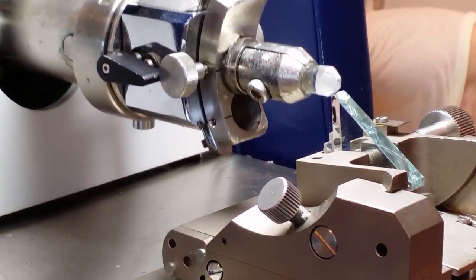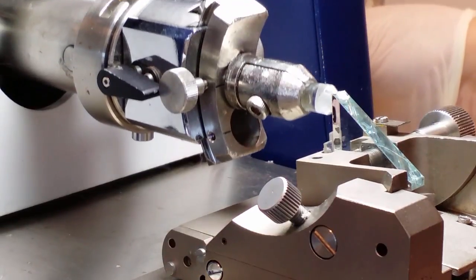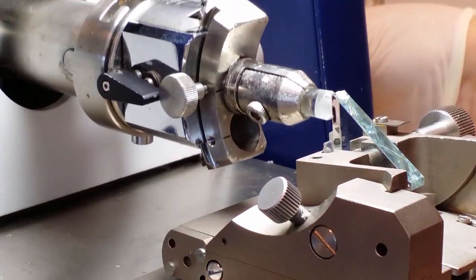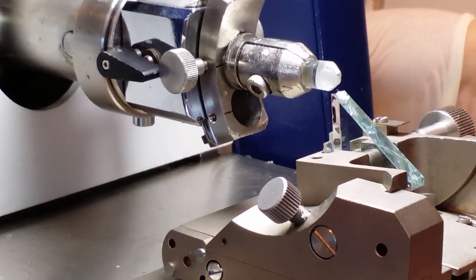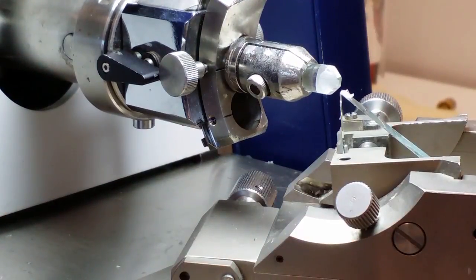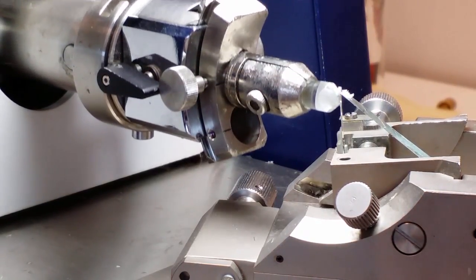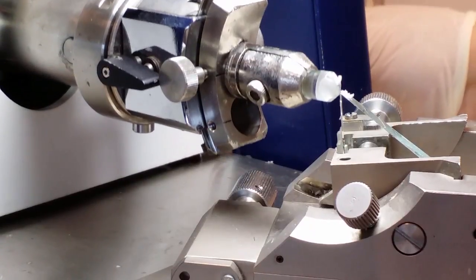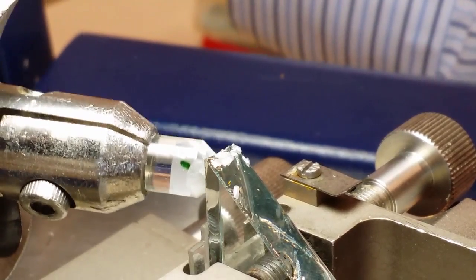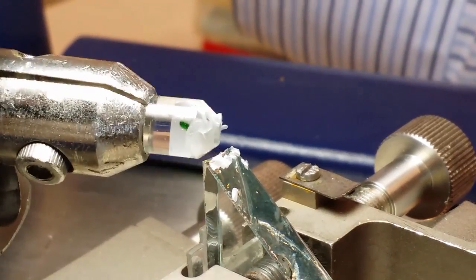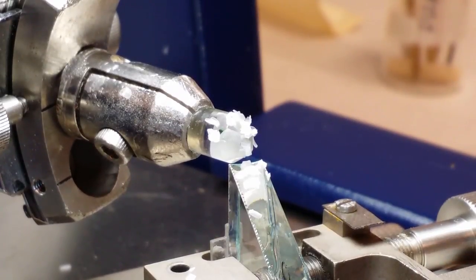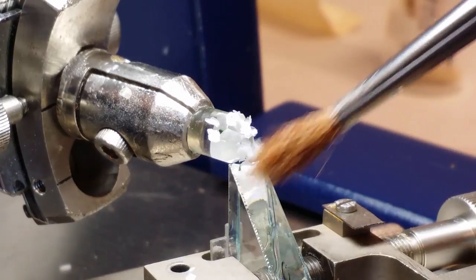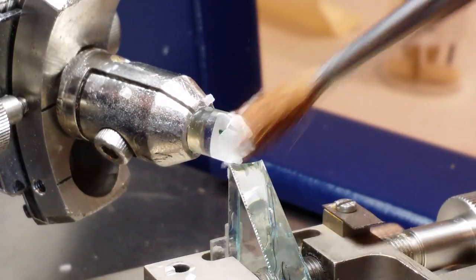So now we are trimming the front face of the piece. This is vital to make it flat against the knife. Otherwise it can come in at an angle to the knife. That makes that you cut the sample unevenly. So now we switch to trim the sides. We want the sides to be at a very very small angle, so the piece will be tapered and not squared shaped in the end. So now let's trim the other side. It can be very nice to have some small brush to clean up when you get lots of pieces here. Then you see better what you are doing.